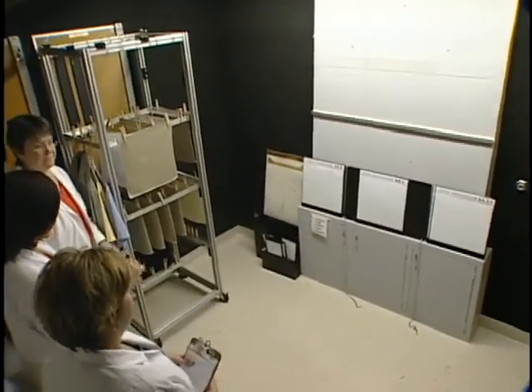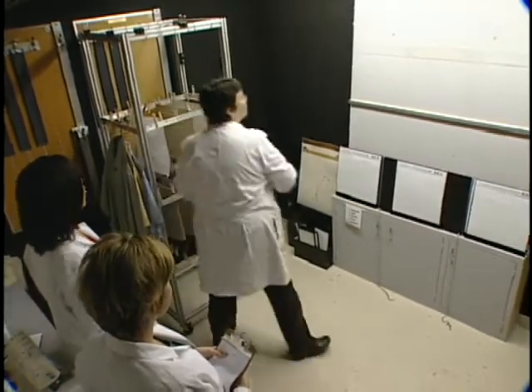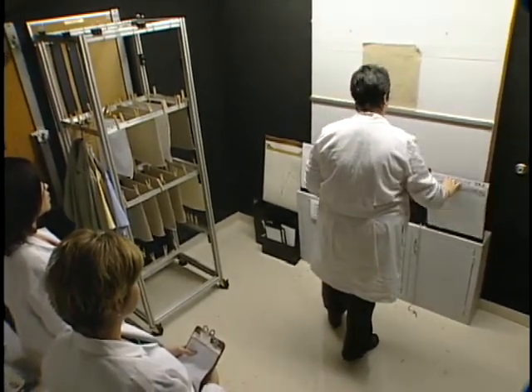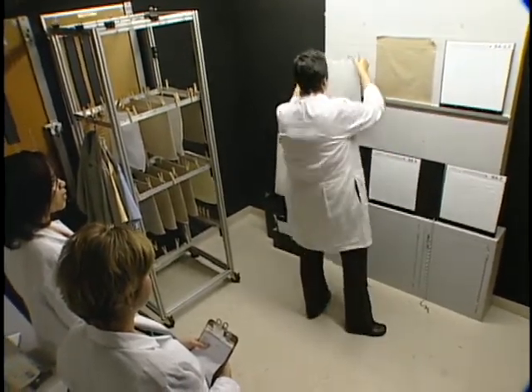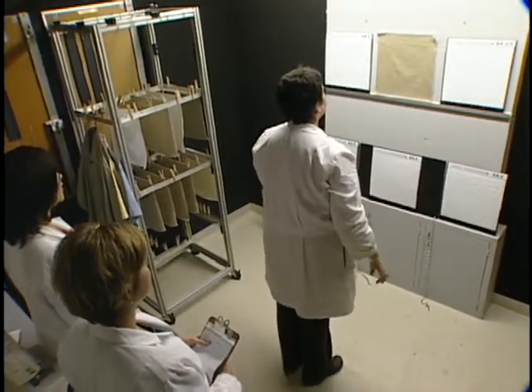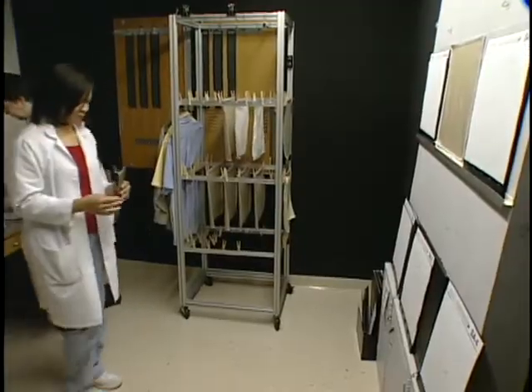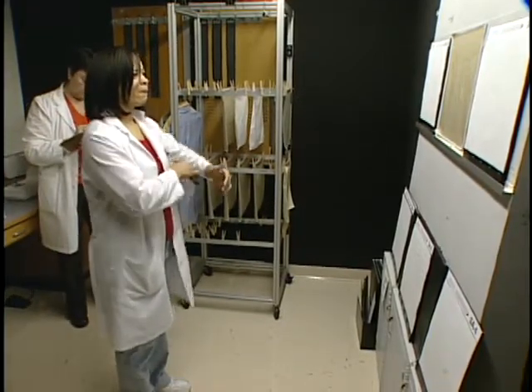The rating evaluation for the specimens should be made by three trained observers who rate each test specimen independently. Overhead fluorescent lighting should be the only light source for the viewing board, with all other lights in the room turned off. Each observer should stand directly in front of the specimen at a distance of four feet away from the viewing board. Specimens should be mounted with the fabric length in the vertical direction, and the most similar three-dimensional plastic replicas should be placed on each side of the test specimen to facilitate comparative rating.